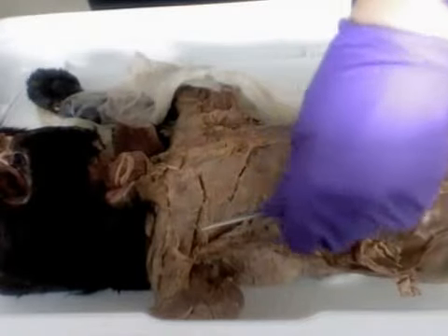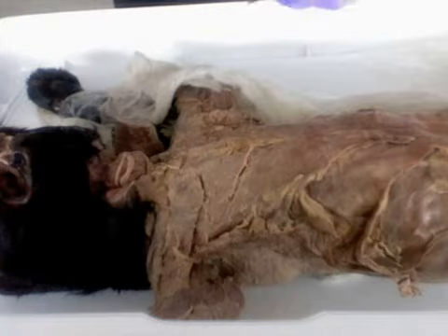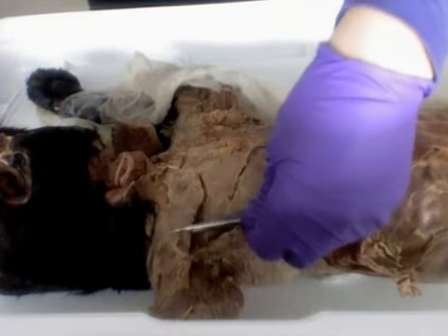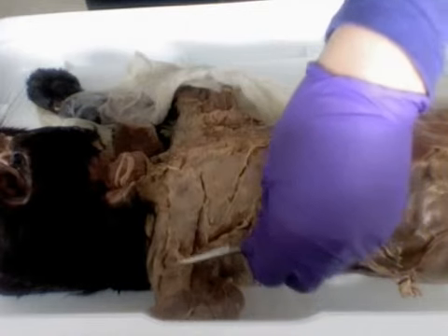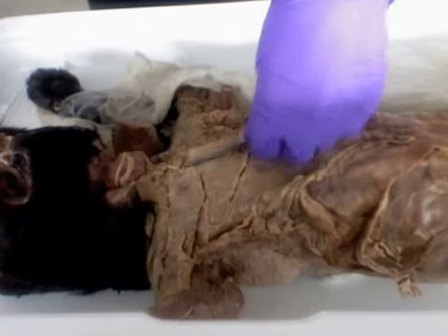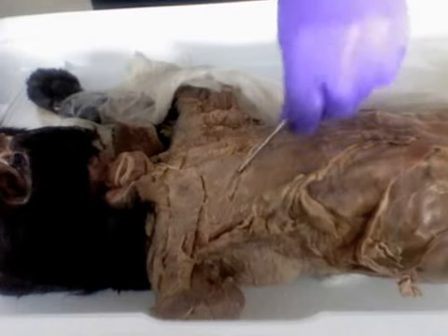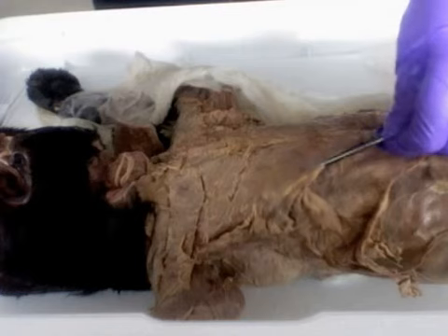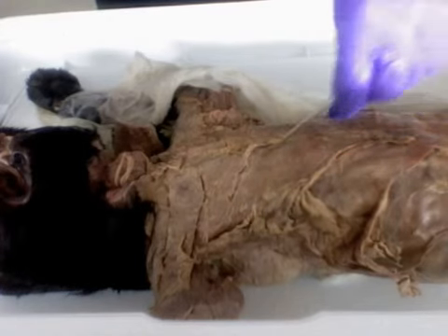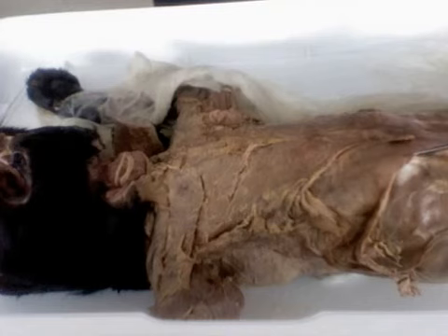Okay, lab number 2, starting from the top of the list, the superficial thoracic muscles. This here is our pecto-antebrachialis muscle. It extends all the way along there. And then right here we have our pectoralis major, right in there. And then our pectoralis minor, this whole piece. And finally at the bottom here, our xiphihumeralis.